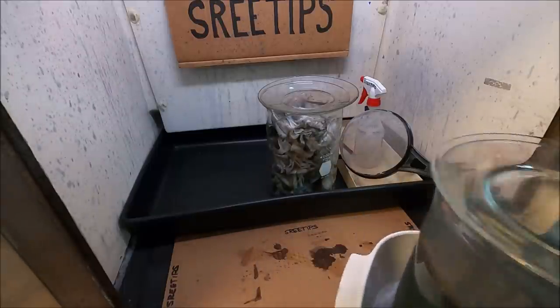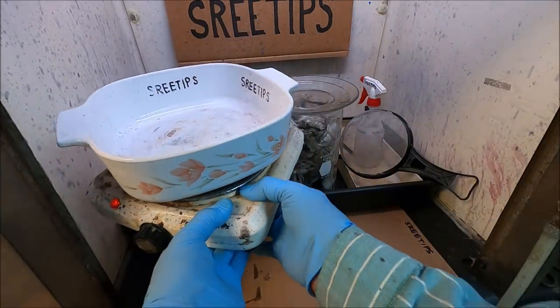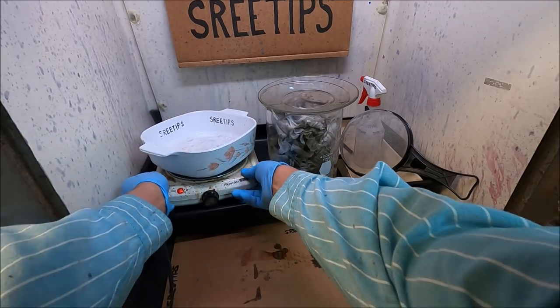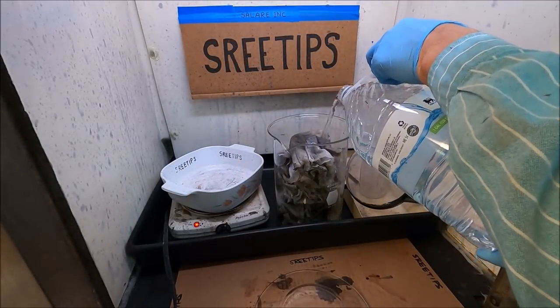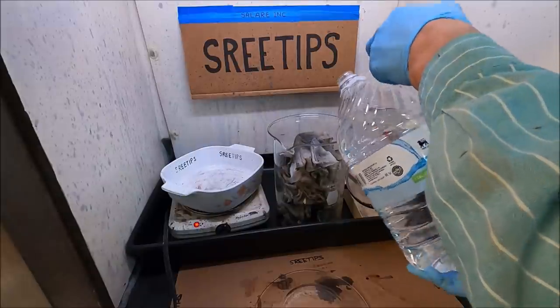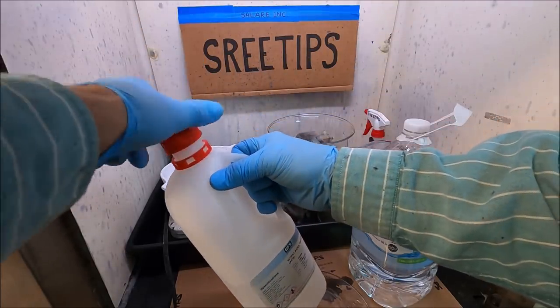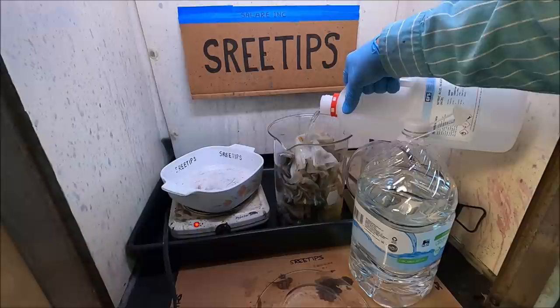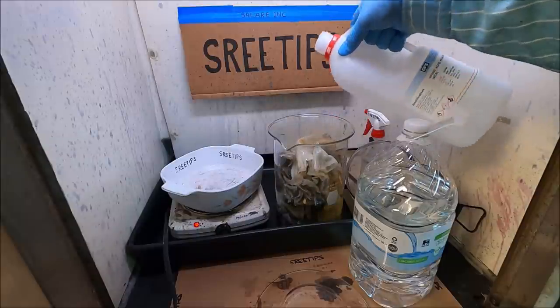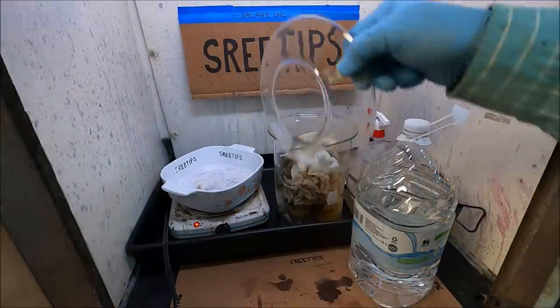Moving this out of the way. Now what we'll do is bring a hot plate over here into play. We'll add some distilled water — about one liter — to these filters right here. Now I'm going to pour in some nitric acid. We're going to try to extract any silver that's remaining on these filters, along with any platinum group metals that might be in there with them. Cover this up and move it onto the heat, let this cook.